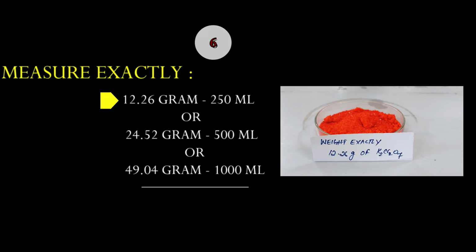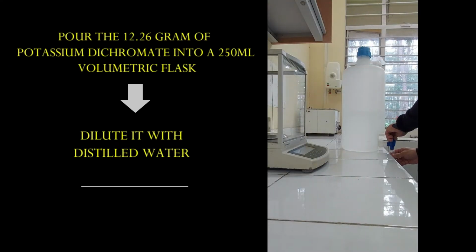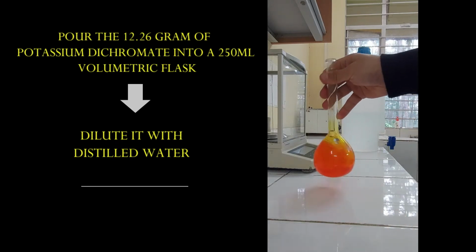However, in this video, I'll be weighing only 12.26 gram of potassium dichromate and diluting it in 250 ml distilled water. Now pour it into a 250 ml flask and then dilute it with distilled water.